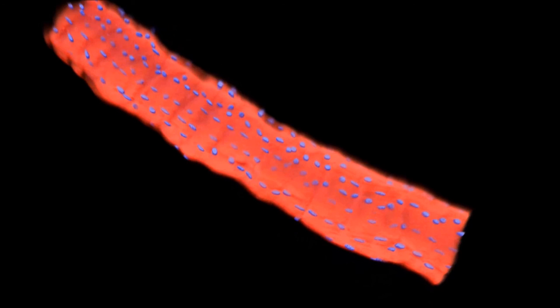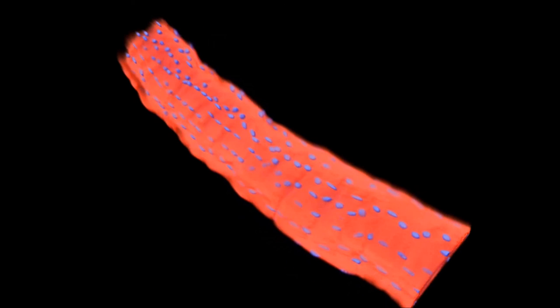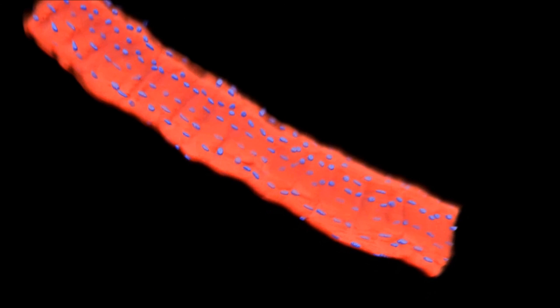What we can get is actually something that looks like this — a 3D muscle fiber from a human. You can see all the blue dots are muscle nuclei, which is what we're typically interested in. We're able to get whole cell volume from this, count the nuclei, look at their shape, look at their orientation and where they're located. We can get a lot of really cool information. We hope to do this technique on athletes, old people, young people, fit people, unfit people, and really see what muscle looks like at the cellular level.